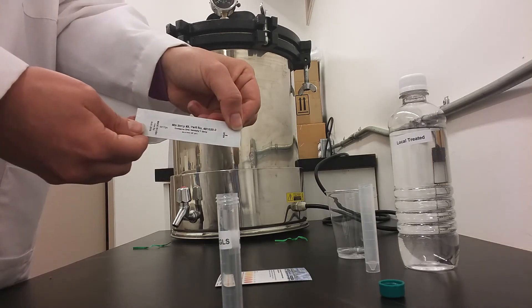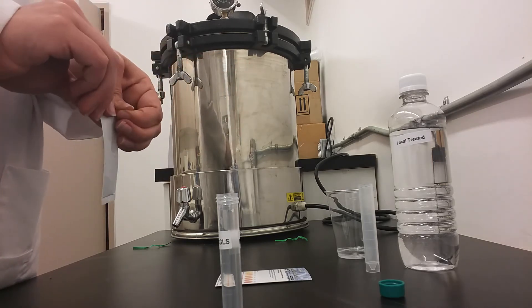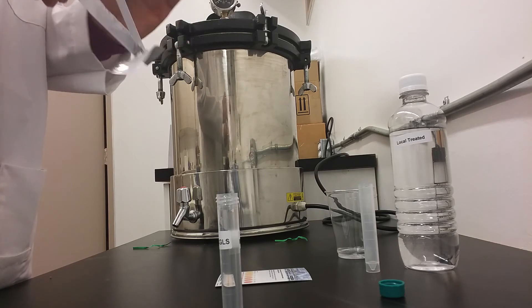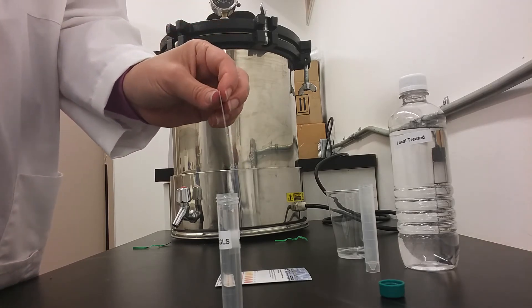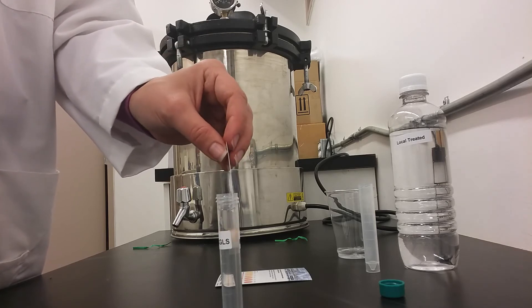Next you will take manganese test strip number 3 and you will insert it in the water, moving gently back and forth for 30 seconds.